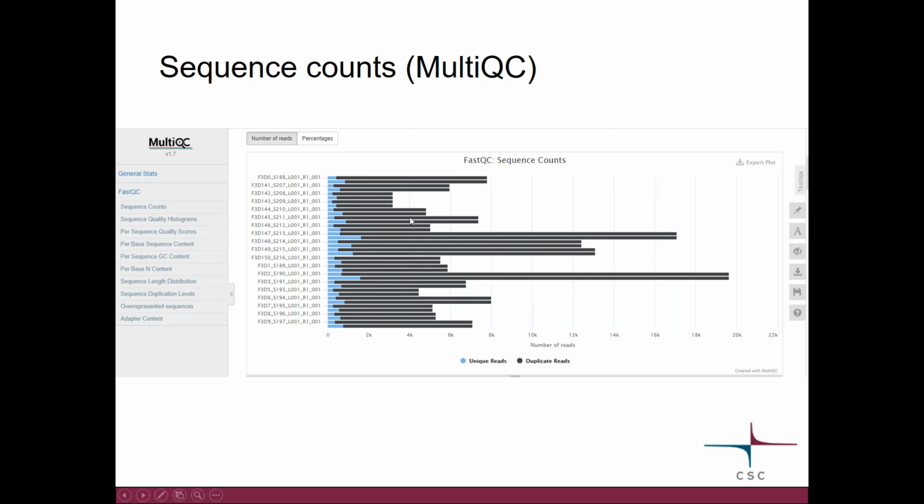MultiQC produces, for example, this duplication plot here. First of all, here you can see the sequence counts. These are my different FastQ files, and it tells me how many reads I had in each of these files. You can see that this is 16S data, so the number of reads varies quite a lot between the samples. Here, for example, we go from 19,000 to about 3,000. So quite a big difference.